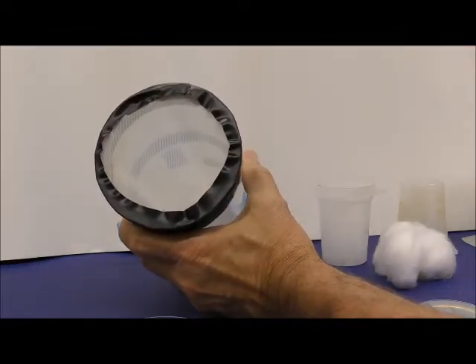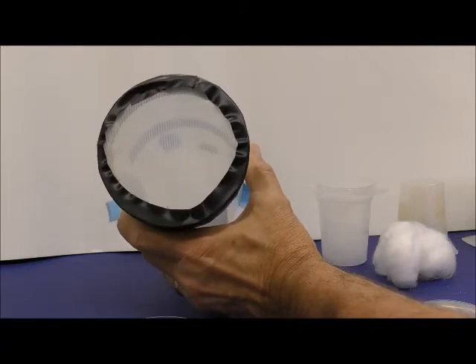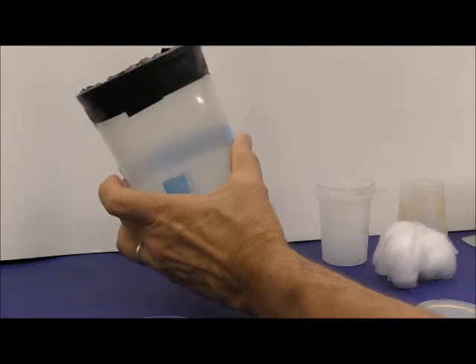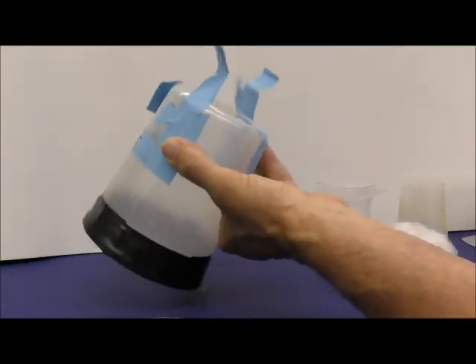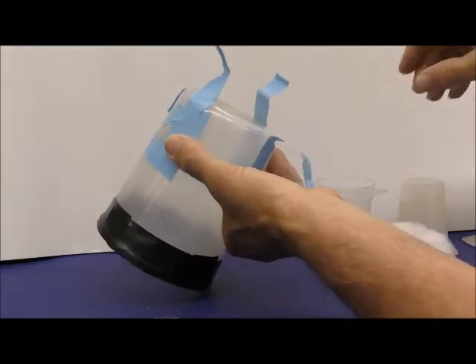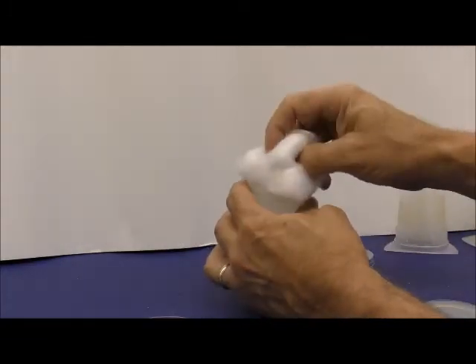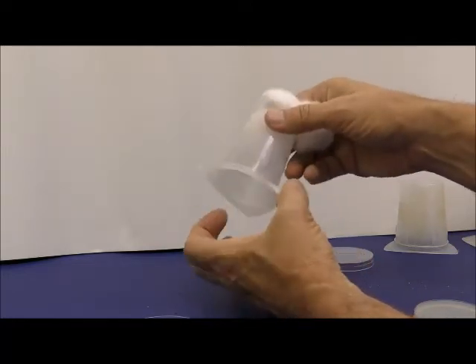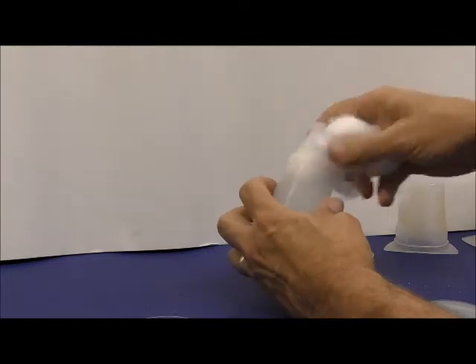One can use a nylon stocking, for example, or some mesh if you find some really tight mesh. Okay, so that's how to make fly chambers. And then you can put your flies in there. These bigger ones are kind of nice because it's easier to push the flies away from the dish when you're changing it. The smaller ones are a little bit problematic because you don't have as much room to move the flies away when you change the dish, and they're more likely to escape.